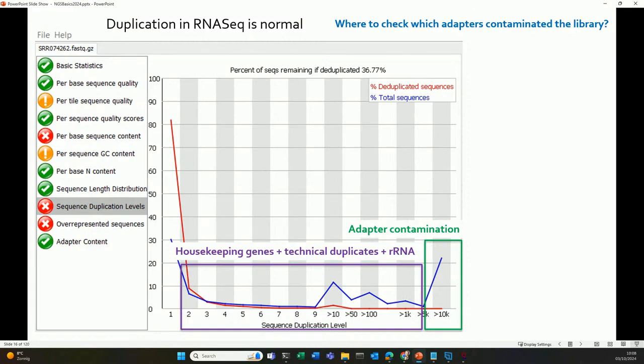Okay. But this is indeed why we see duplication. And in this plot, what you look at is, do I see this peak here? Do I see a peak at the utmost right? If you see a peak at the utmost right, it can be adapter contamination. For RNA-seq data, seeing peaks here doesn't matter. He will never be happy when you give him RNA-seq data because there will always be duplication here. But that duplication is fine. Most of it is biologically relevant.